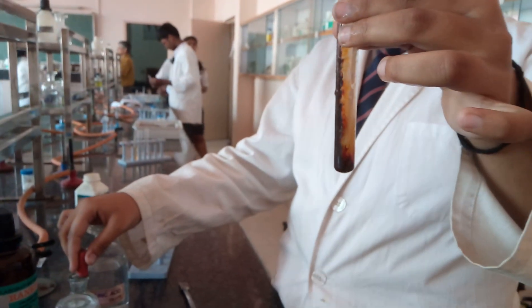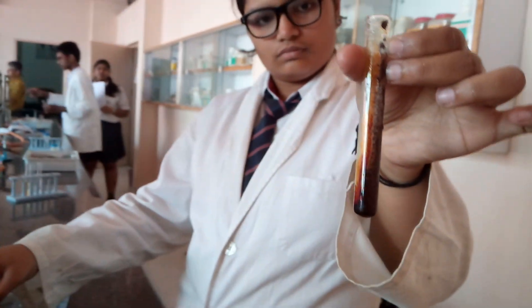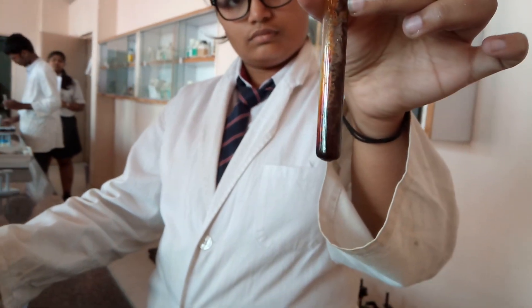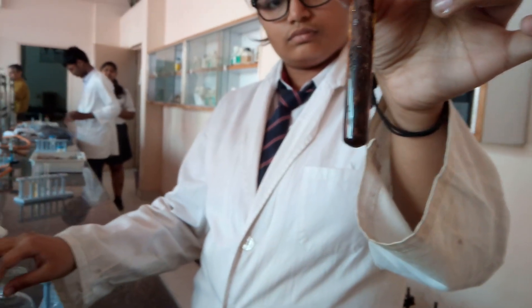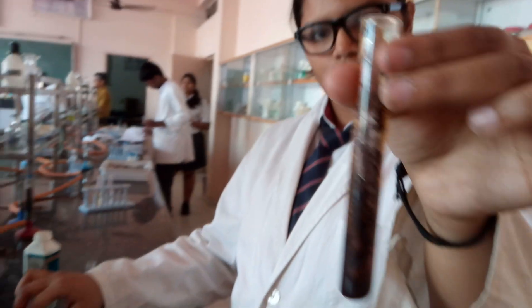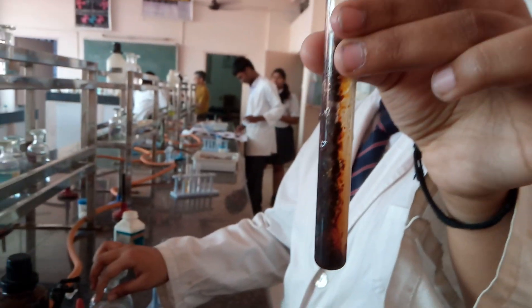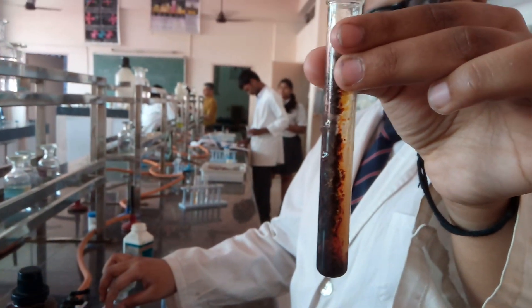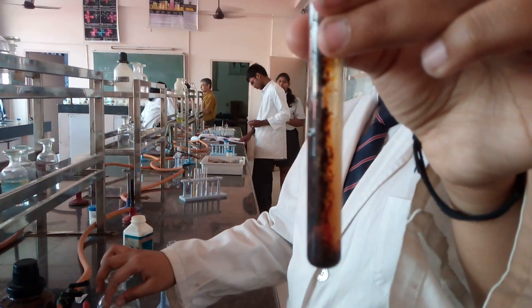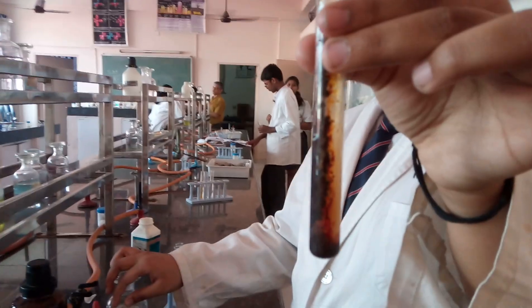There is a brownish colored gas — actually it is violet in tinge, but the distinction is difficult. There is some violet variation along with dark brown colored gas. In the upper end, a violet coloration is observed, but otherwise it is pretty dark, dense fumes which are visible.